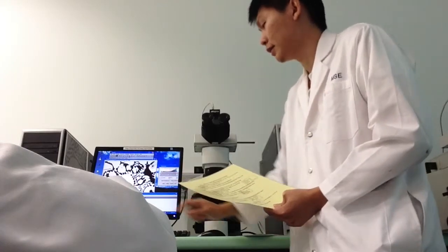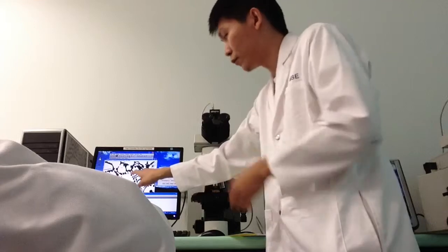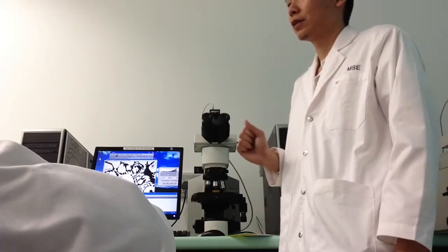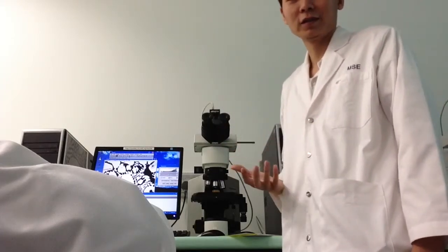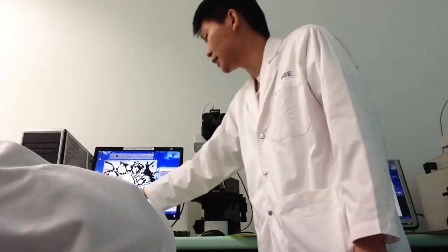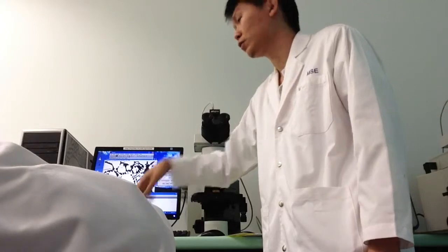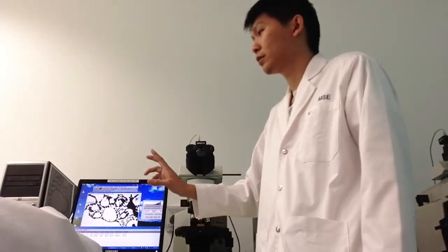One thing to note is that the percentage area for your freehand must be less than 5%. If it is more than 5%, you have to do the freehand again. So the set of values which is more than 5%, you undo. You should end up with two sets of values.